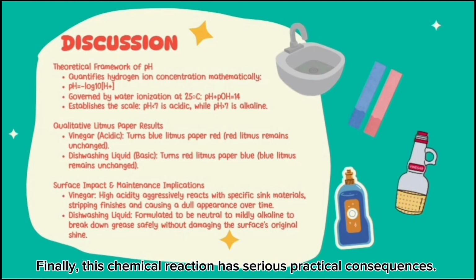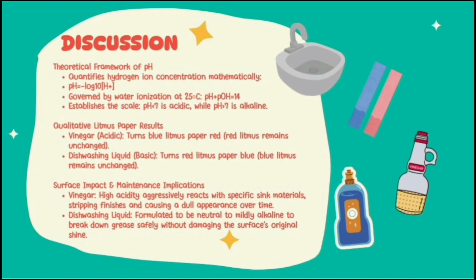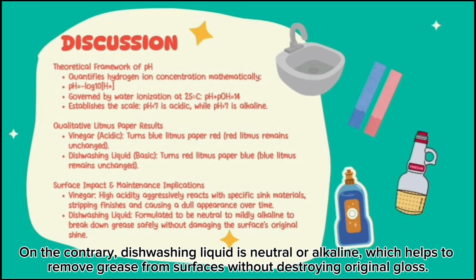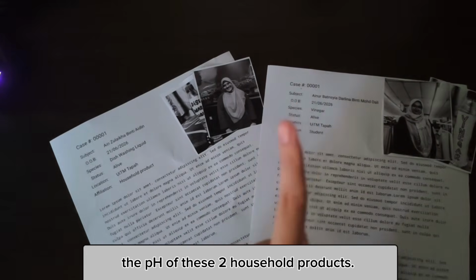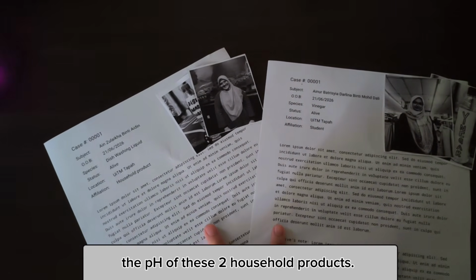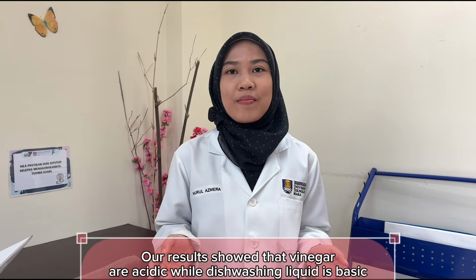Finally, this chemical reaction has serious practical consequences. The strong acidity of vinegar leads to fast reactions with particular substances in the sink and causes dullness over time. On the contrary, dishwashing liquid is neutral or alkaline, which helps to remove grease from surfaces without destroying the original gloss. After examining all the evidence, we successfully determined the pH of these two household products. Our results show that vinegar is acidic while dishwashing liquid is basic.